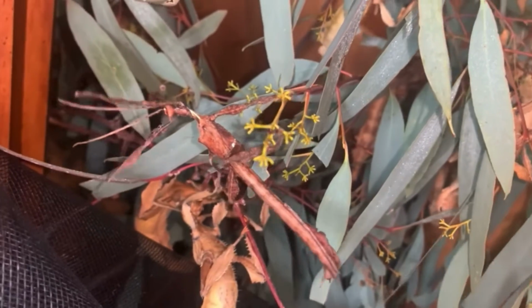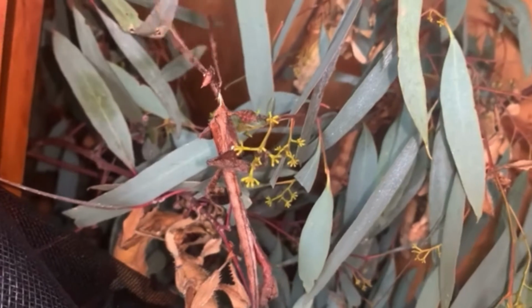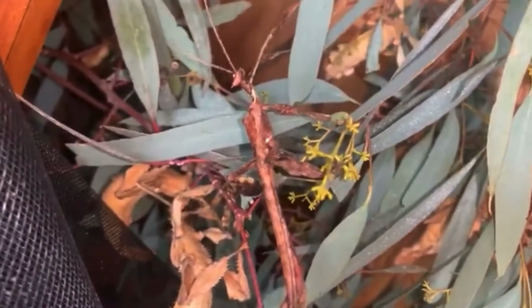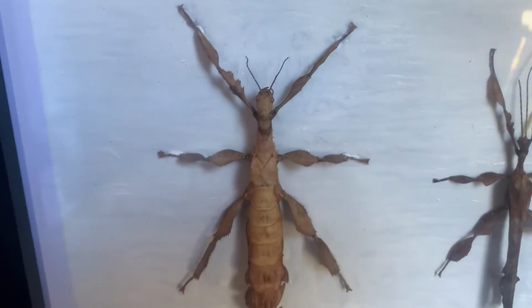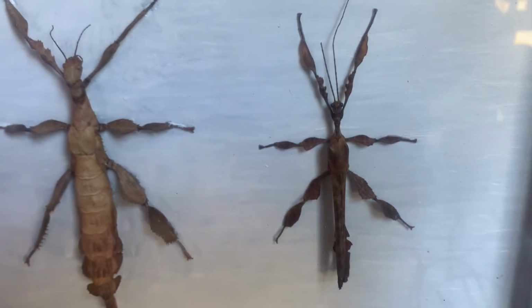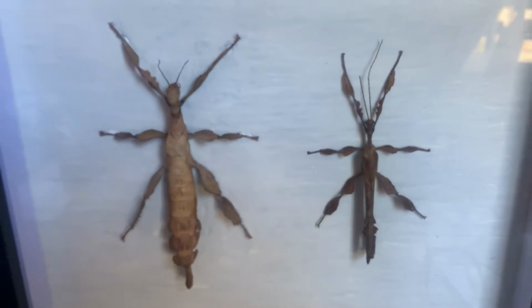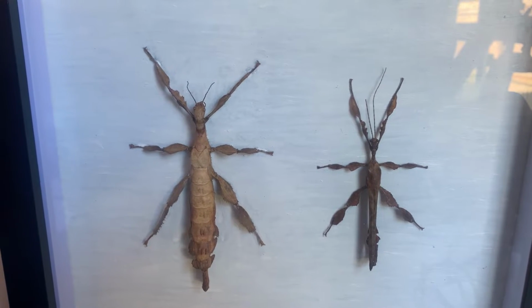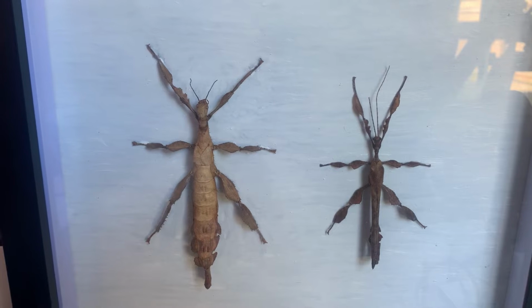In this video, we will be discussing the anatomy of the male Extatosoma tiaratum in full detail via dissection and microscopic photographs. Due to how small the male Extatosoma tiaratum is compared to the female, we will only discuss the features that can be seen easily in the male stick insect. Because of this, the female internal anatomy video will be a more thorough video about the overall internal anatomy.